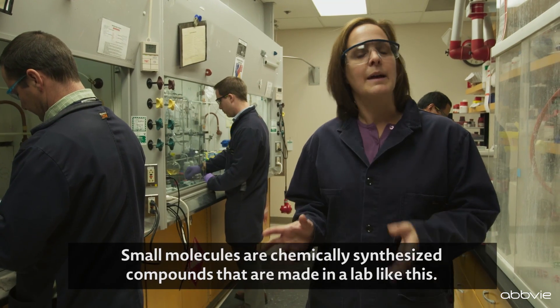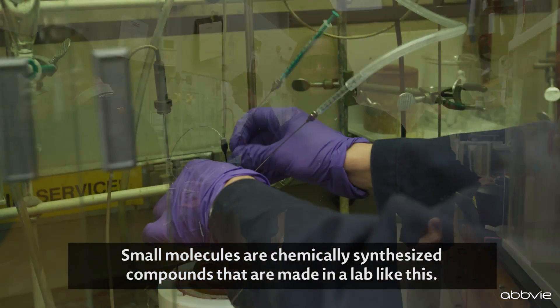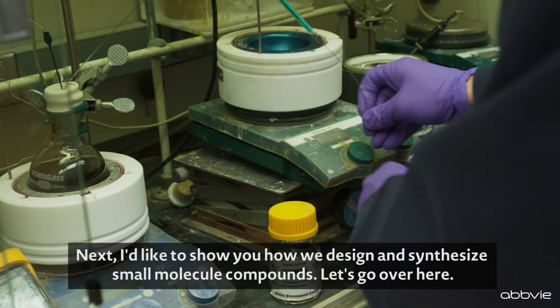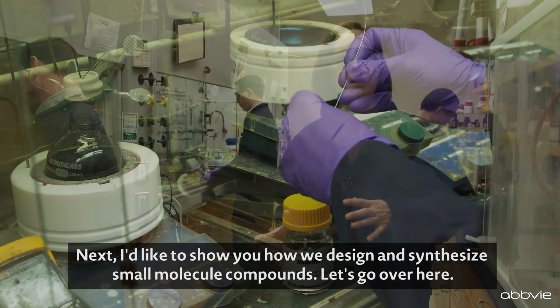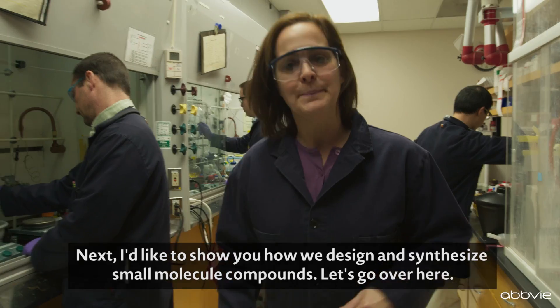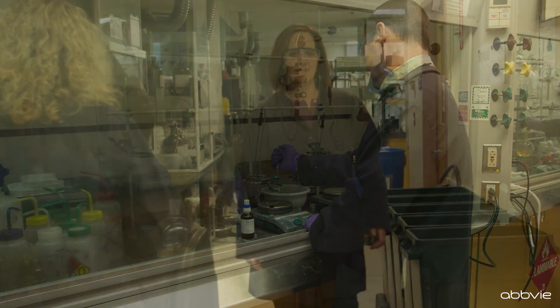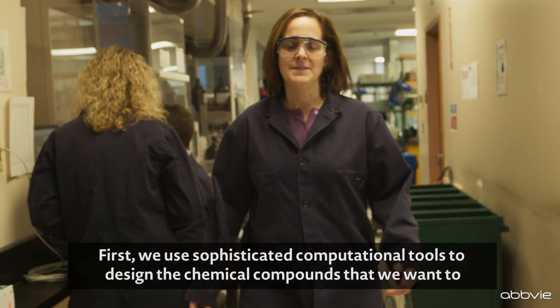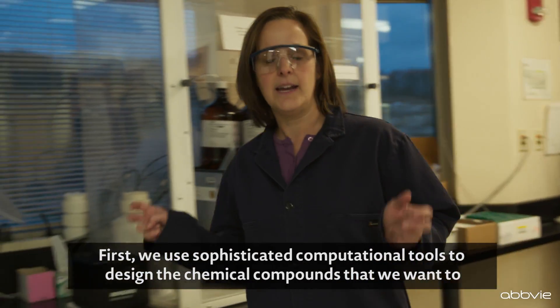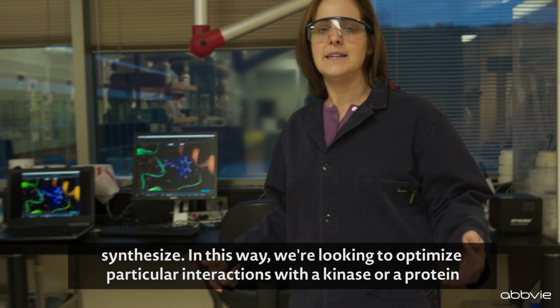Small molecules are chemically synthesized compounds that are made in a lab like this. I'd like to show you how we design and synthesize small molecule compounds. First, we use sophisticated computational tools to design the chemical compounds that we want to synthesize.